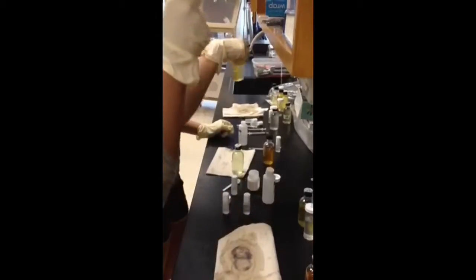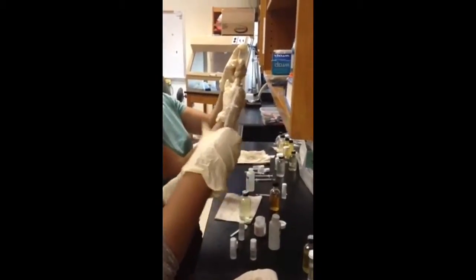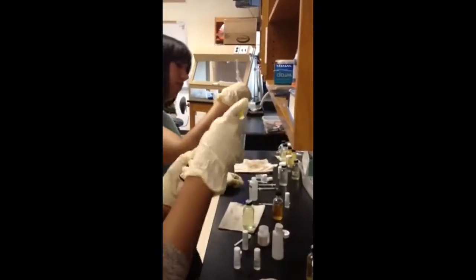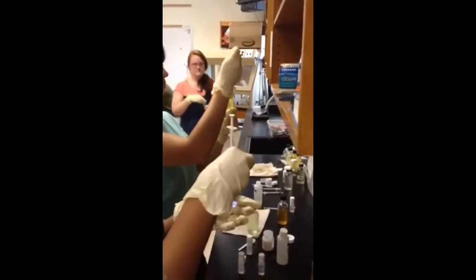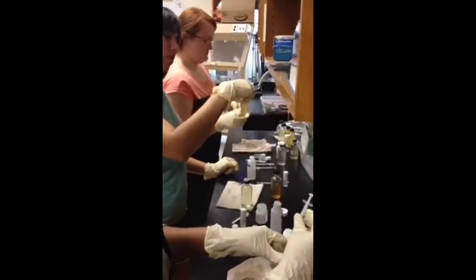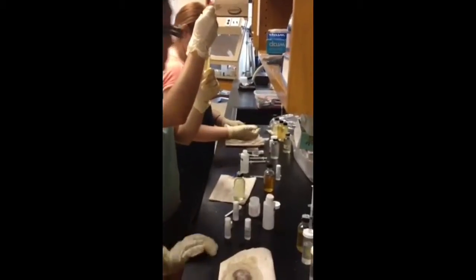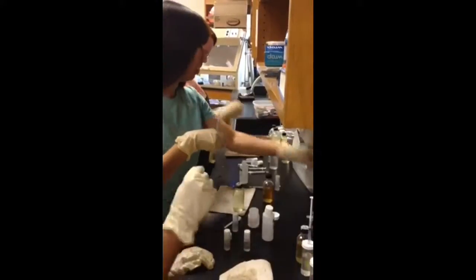The experiment is to determine the effect of sulfuric acid on the health of an aquatic ecosystem, and we are doing that by measuring the amount of dissolved oxygen present in relation to the amount of sulfuric acid we put in each bottle. And the purpose of titrating is to determine the amount of dissolved oxygen in each bottle.